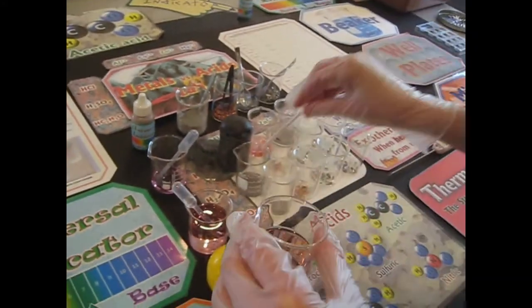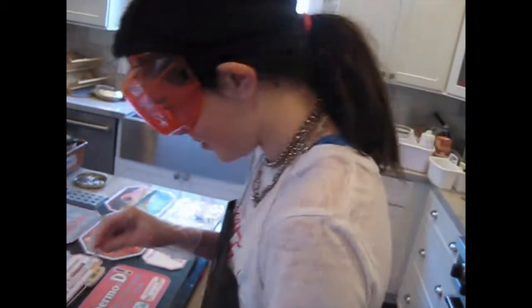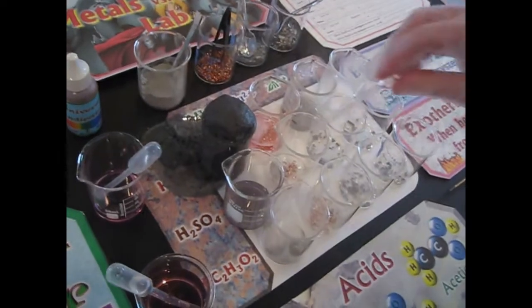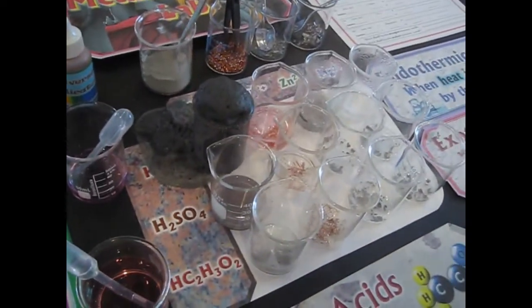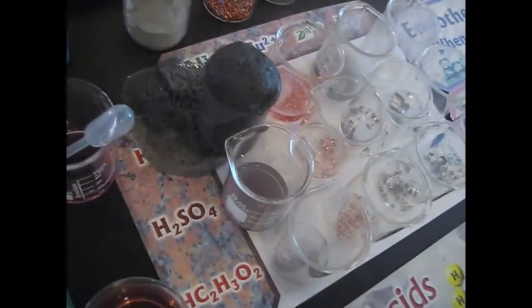Can you mention anything about the smell or the odor? It's like tingly I guess. Do you know how I would describe it? Nasty. It's not good. We've got all the ventilation going, so this is not going to be confined.